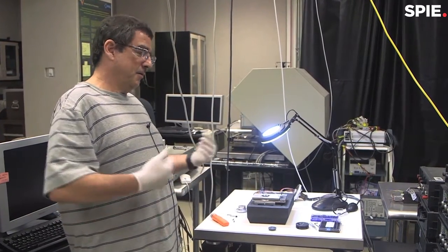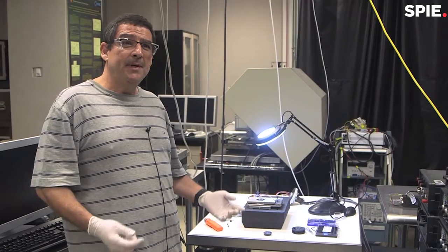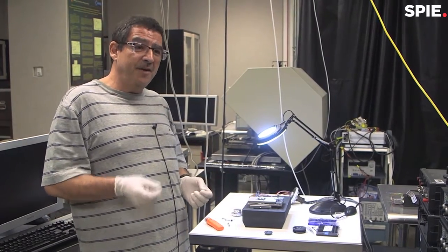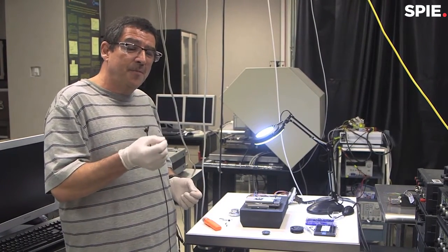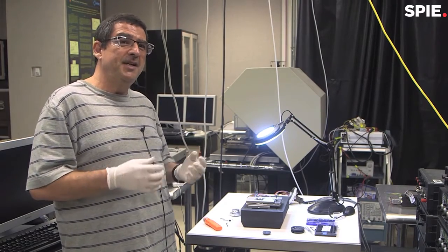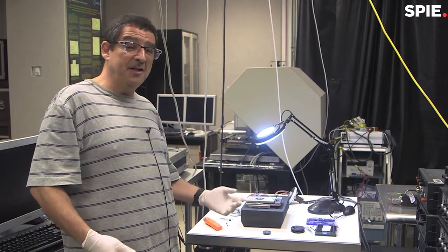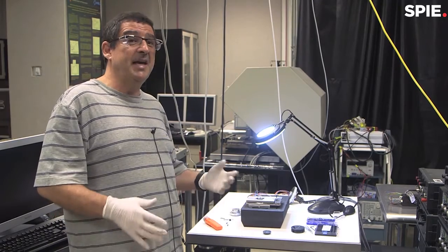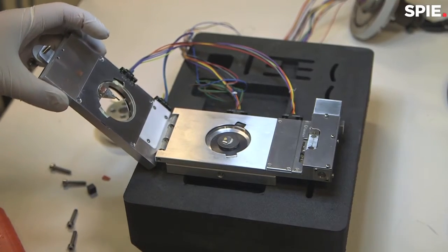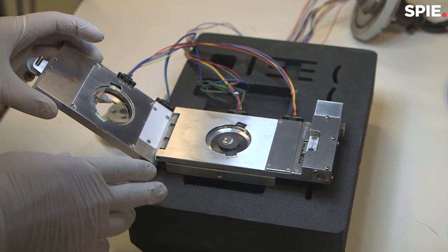So we are doing the next step, which is using an NSOM scanner. An NSOM scanner uses very small probes at very small distances, and with these you can break the diffraction limit and achieve very high magnifications. Here you can see the stage of the NSOM scanner.